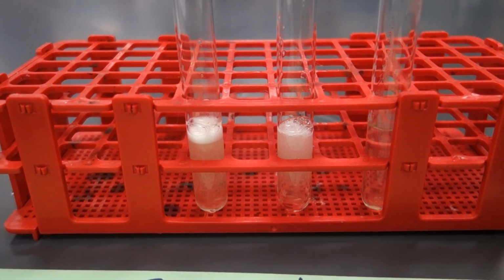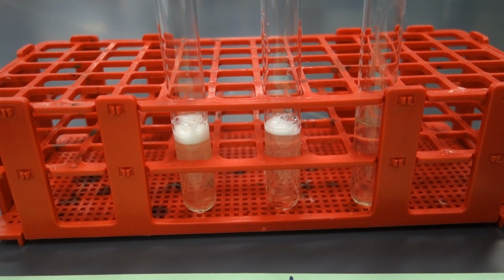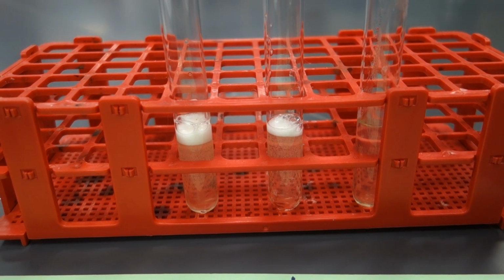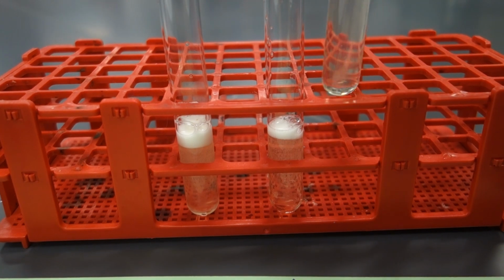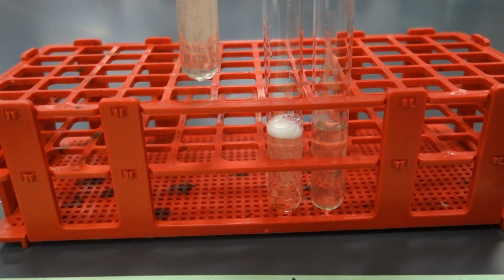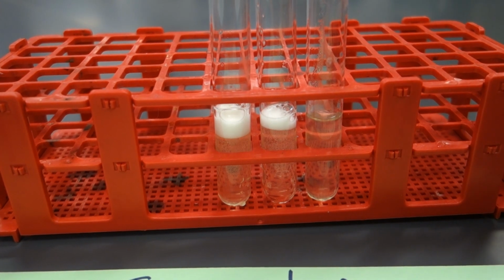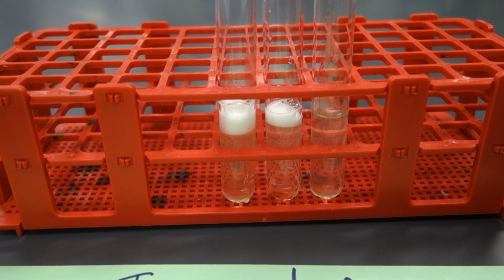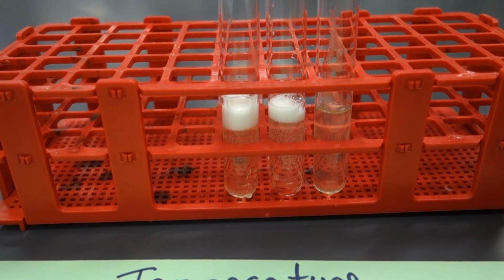So if you're looking already, you can see that there's some activity in test tubes 1 and 2. All right, we are producing oxygen bubbles during this reaction. So again, remember we are using a potato as opposed to a human. This potato does not produce its own body heat, right? So its temperature is going to be a little bit different. Remember, all enzymes really have an optimal environment. They have a homeostatic environment. They have an optimal temperature, an optimal pH, an optimal everything.